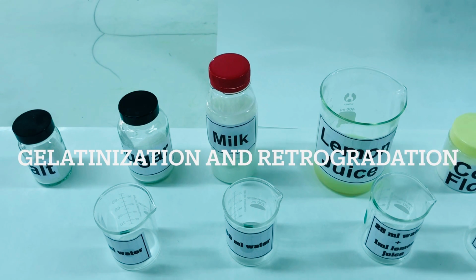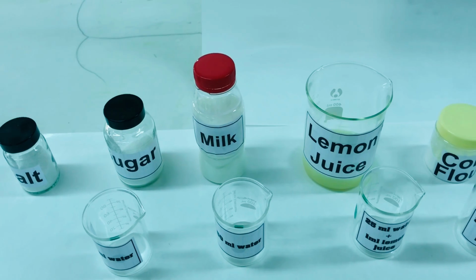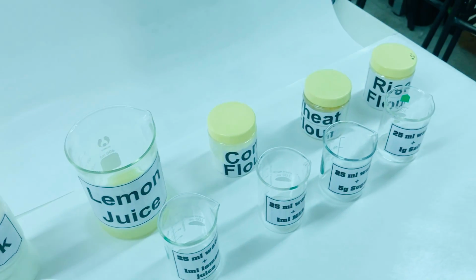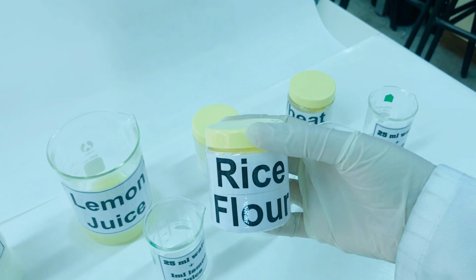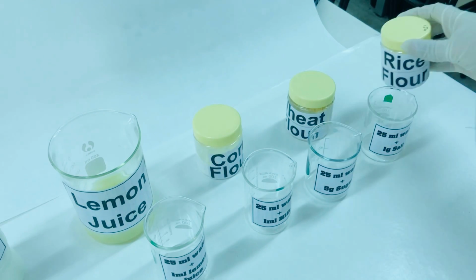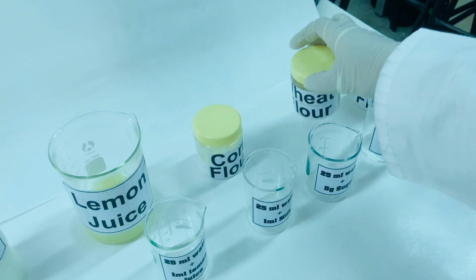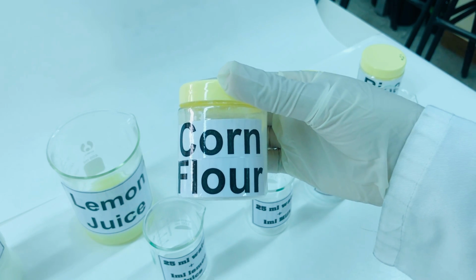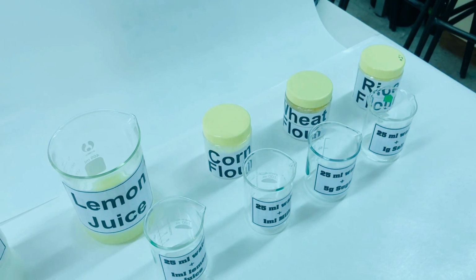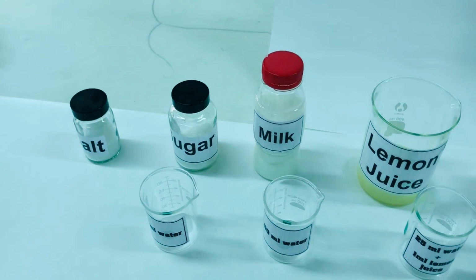The experiment that we are going to do today is about gelatinization of polysaccharides. One of the polysaccharides is starch. So, the source of starch that we are going to use in today's experiment is rice flour, wheat flour and corn flour. We will also see what is the effect of various factors on the process of gelatinization.